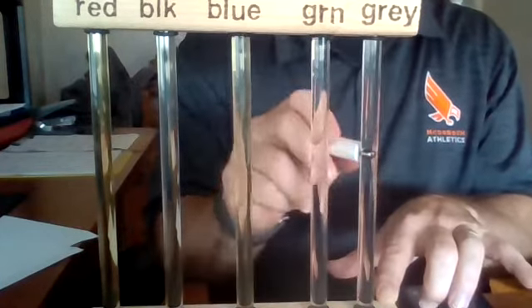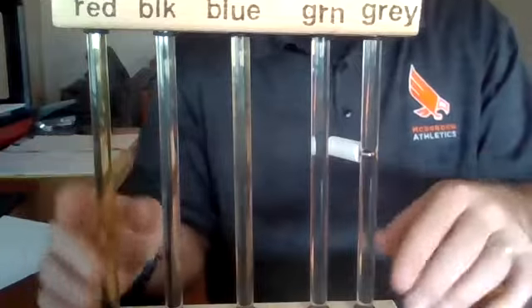And 6.80. Again, as you've done before, take your 5 numbers, add them up, divide by 5 to get your average, and you'll be creating a comparative bar graph or column graph on those 5 different types of petroleum oil.